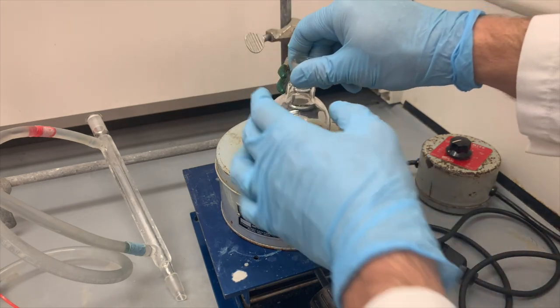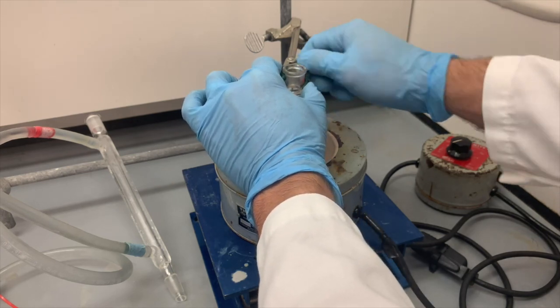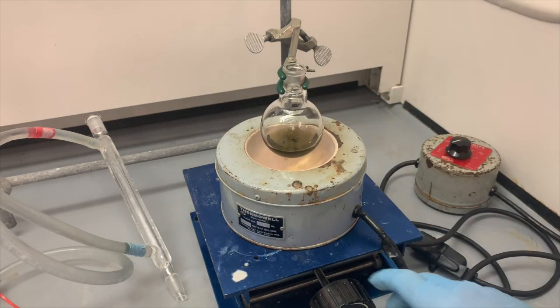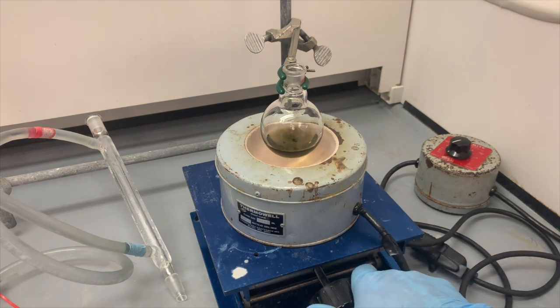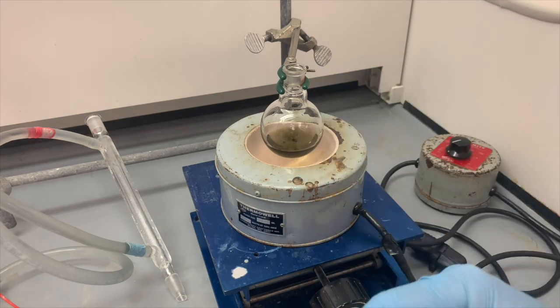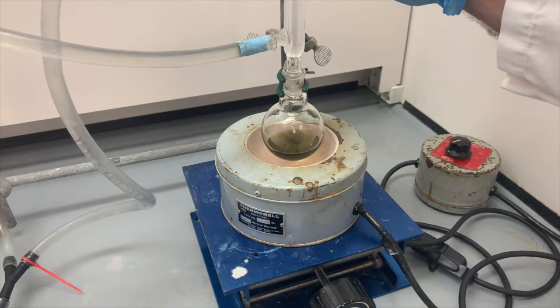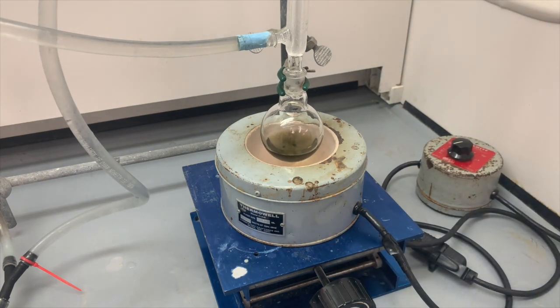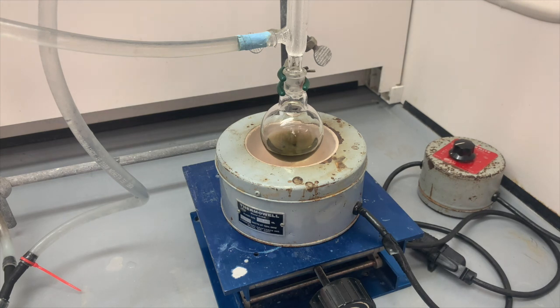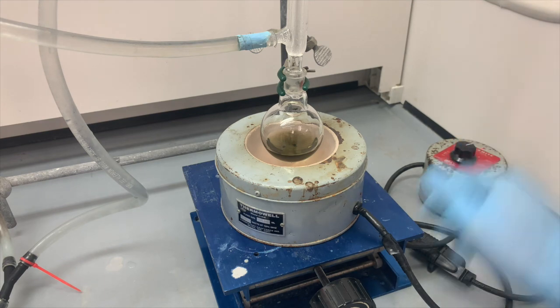The sodium hydroxide pellets are still there. So for the first part of the reaction, even though proton transfers generally happen pretty quickly, we're going to heat this up and let it reflux for about 15 minutes, just so that all that sodium hydroxide gets dissolved and can react. Before we begin with the heat, we want to make sure we place our condenser on top. And now we are ready to heat. I haven't plugged in my variac yet. Now we will. So I'm going to start cranking up the heat here on the thermowell.